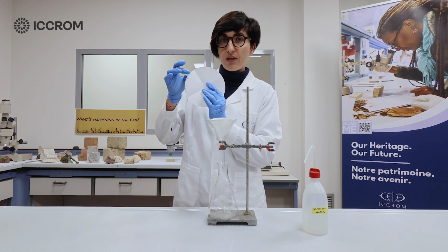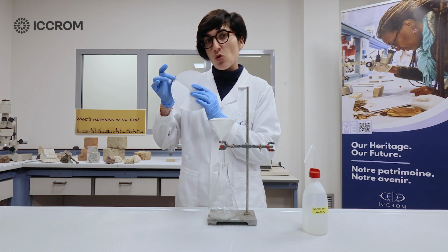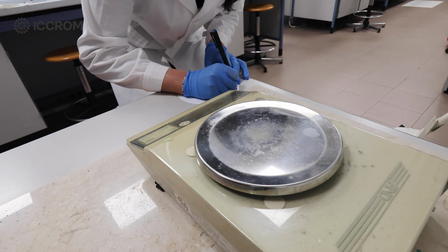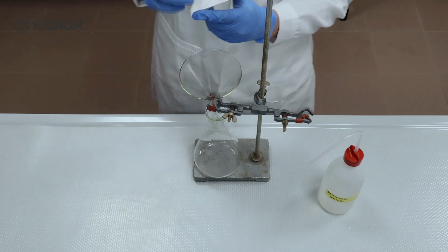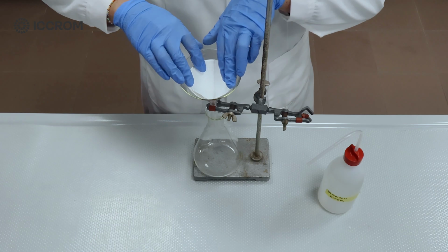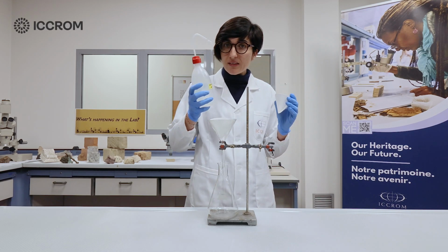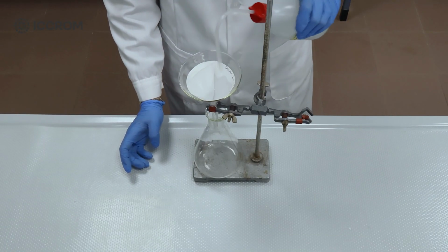It is very important that you carefully prepare your filter paper. You need to label the filter paper with your sample name using either a pencil or a pigment pen only, and also record the weight of the filter paper dry. When ready, start folding it in 4 and then gently place it inside your glass funnel. Right before you start the filtration, make sure that you gently pre-wet your filter paper to reduce surface tension.